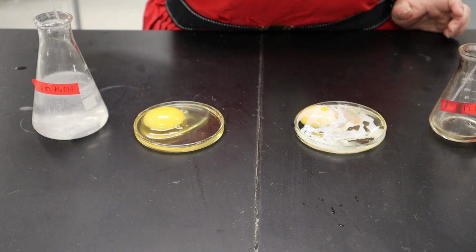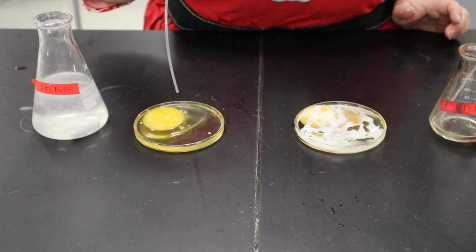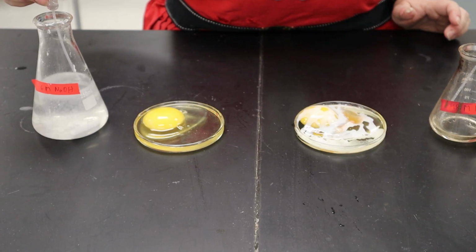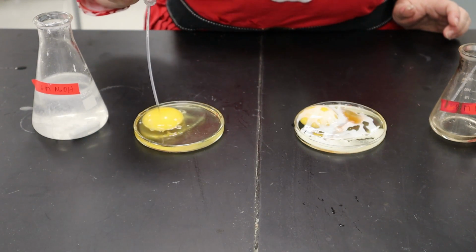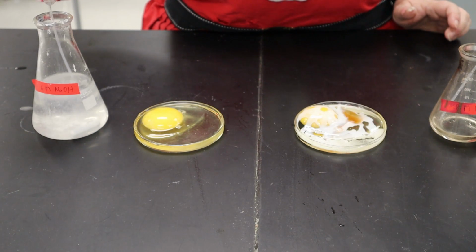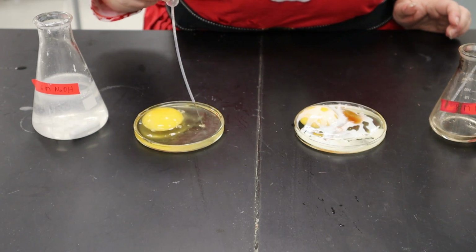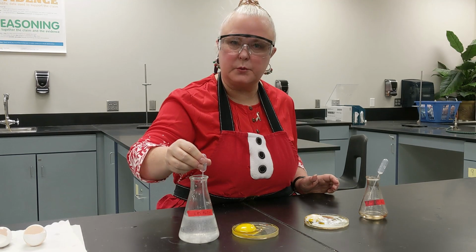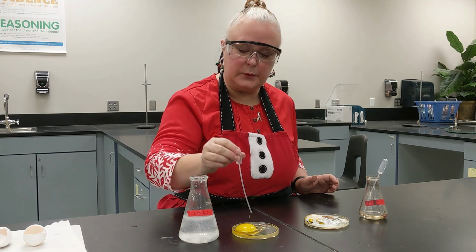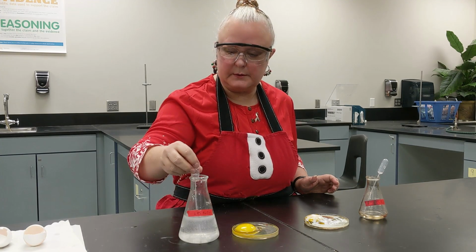All right, we're not seeing the change the same way, but there is a change occurring. Once we put this on here, if we wait for a few minutes, then it starts to turn into what looks like soap. It makes it a solid. So bases, if they're strong or even sometimes if they're weak, turn fatty tissues into a soap-like substance. We do that when we are making soap, and we'll let that one sit for a little bit.